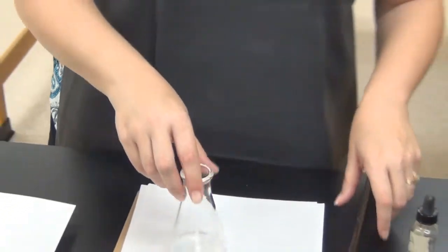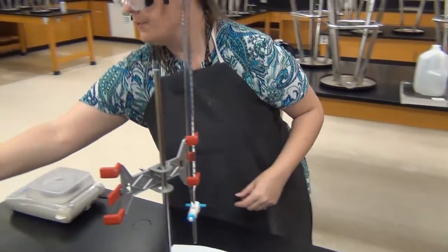In fact, I will go ahead and add a little extra water so I have some extra solution to see swirling around. And this might concern you.